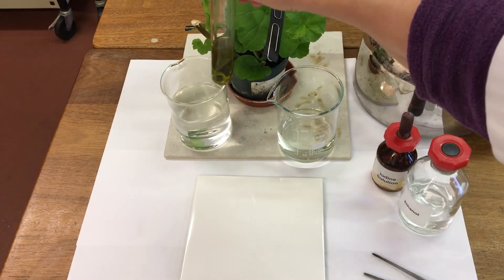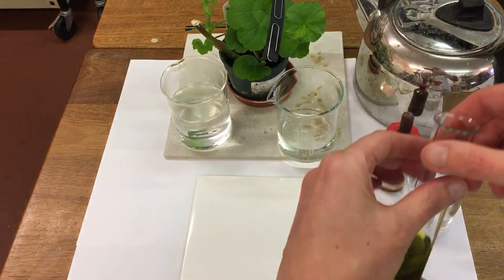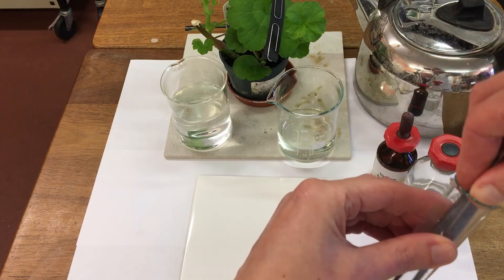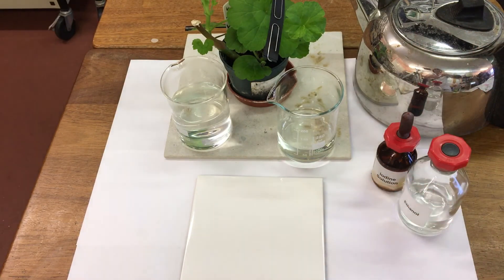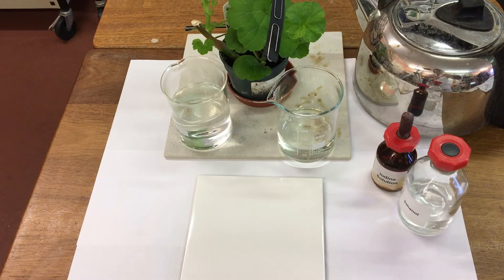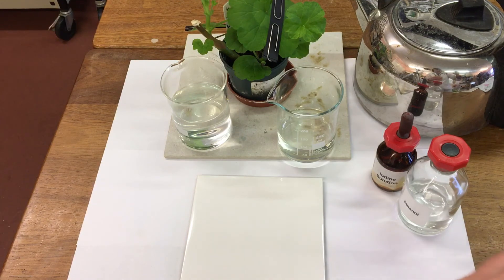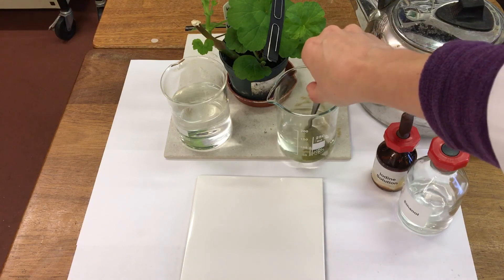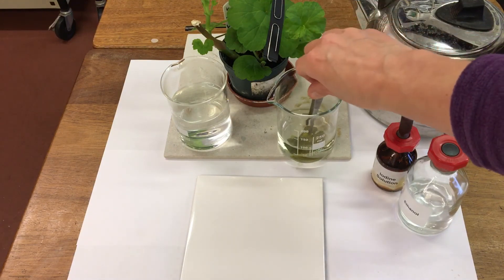So next, we're going to give our leaf a wash. So wash it in the boiled water.